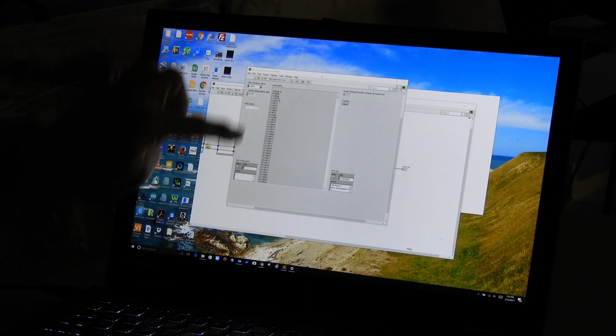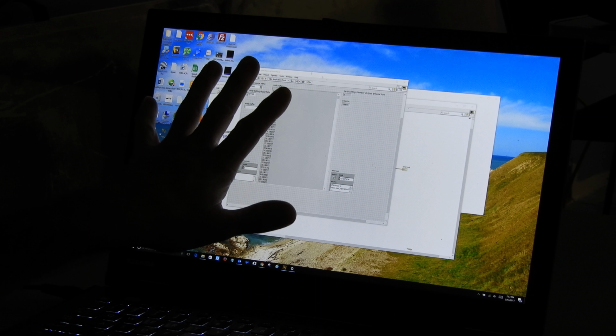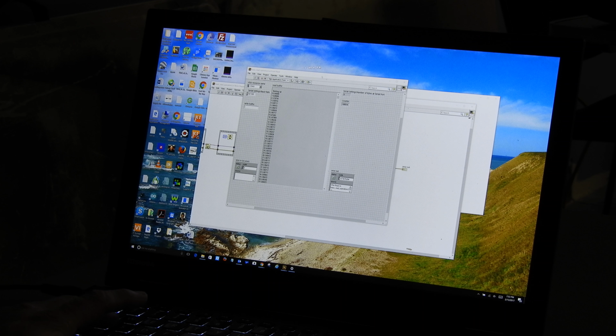All right, so what we're going to try to do here, I've got LabVIEW. I've got a driver that has acquired all these numbers. These numbers need to go into a graph for us to see nicely. This was acquired from the CCD on the Raman project. And the problem is it's numbers, not a graph. So we want to make a graph out of it.